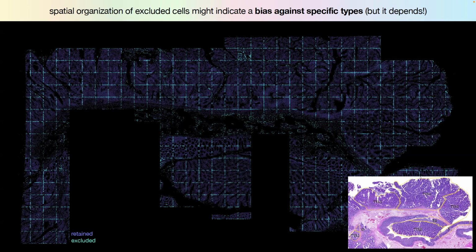In this case, in here is mostly smooth muscle and myofibroblasts, so it makes sense we're removing a lot of cells. And then actually for this tissue, I emailed Bruker and I asked them about this field of view. And then they said this was out of focus. The microscope didn't get that field of view. So now it's been removed. So just be kind of sure that what you're seeing with the filtering makes sense. And if it doesn't make sense, you should rethink, maybe.